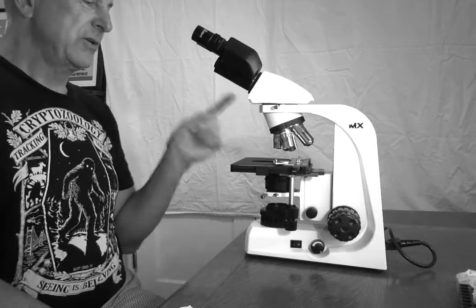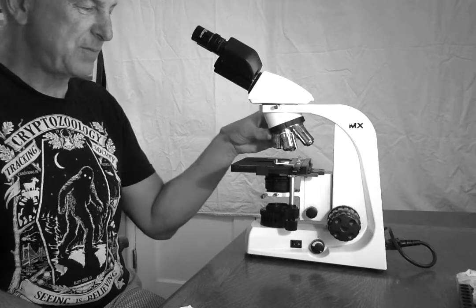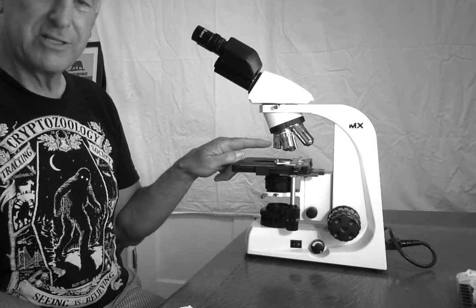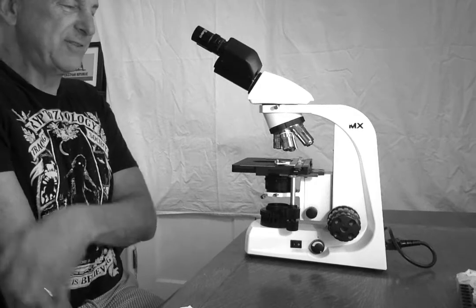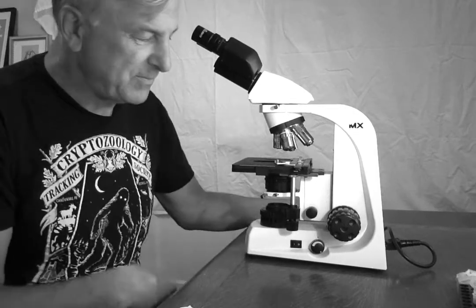Third, you are going to always start observing with the lowest powered objective, which in this case is a 4x objective up here. It's the shortest, it has the lowest magnification, and it is the safest to start with to avoid damaging the microscope.